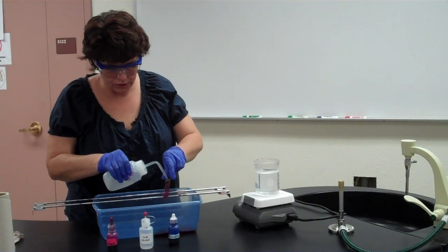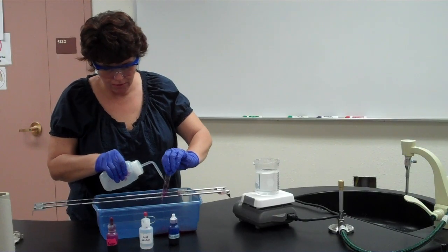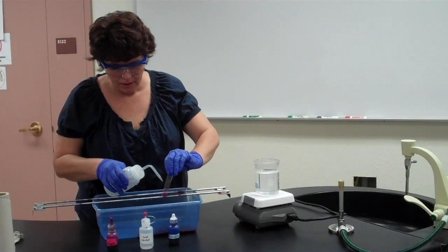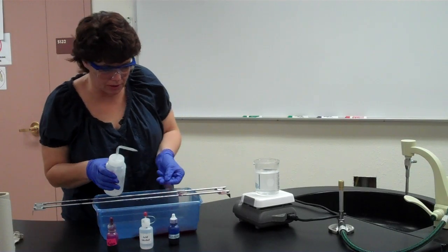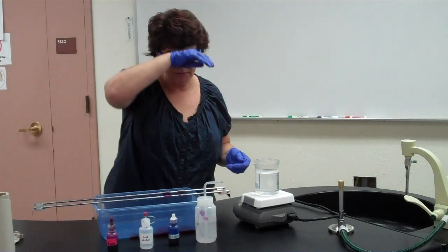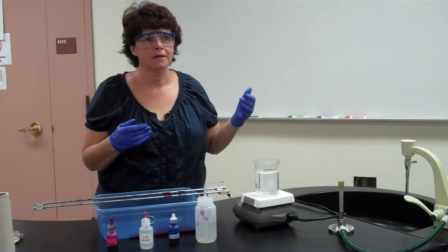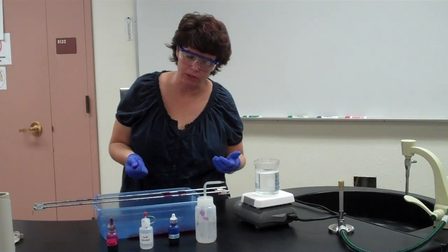Now with the procedure, you have a couple of bacteria that you're going to use. It's up to you how you want to do it. You can put both of them on the same slide, or you can put them on separate slides. Remember, it's important to label properly. When you go to label your slides, you can abbreviate it like MS for Mycobacterium smegmatis, okay, which is the bacteria we're going to use.